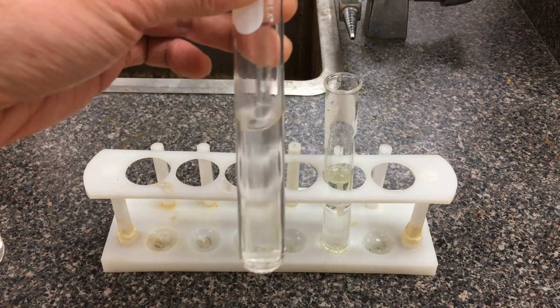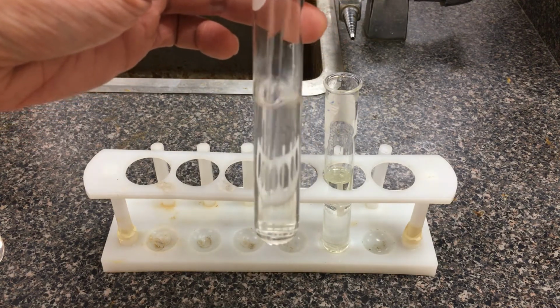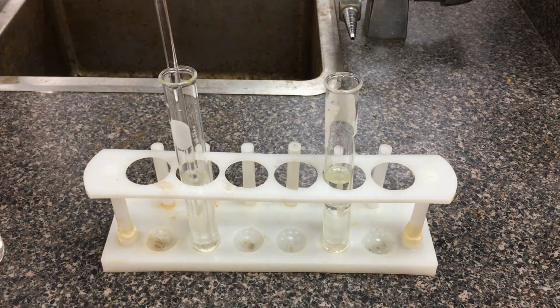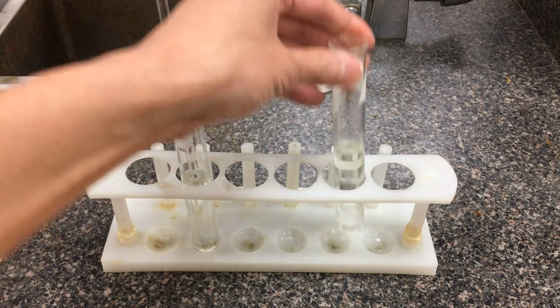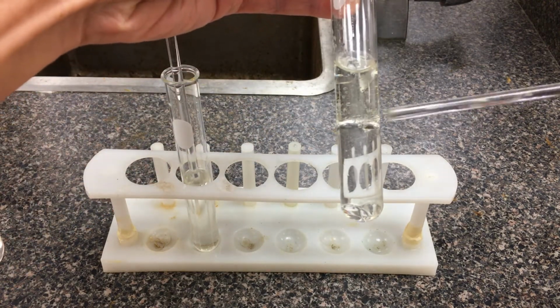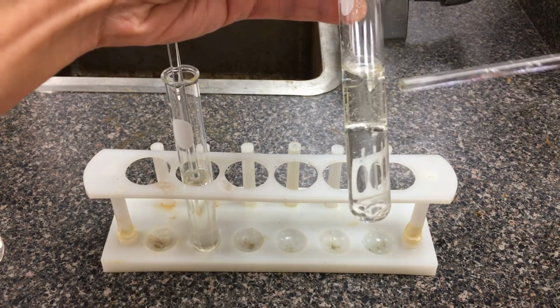So this is the water and acetone here. There's no boundary between the two different solutions, so acetone and water. And the oil and water, you should already know here. Even in English, we usually say oil and water don't mix. So we have the oil layer on top. We have a distinguished layer between the two solutions. We would say the oil and water are immiscible.